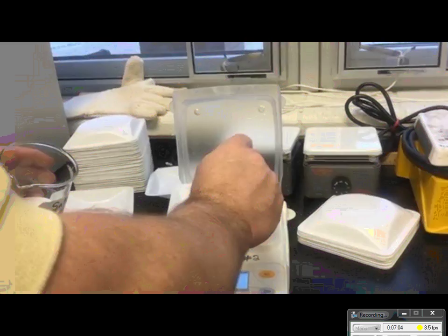36.53. Let's set that a little slower now.